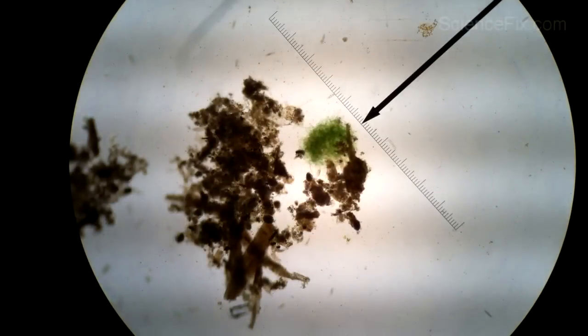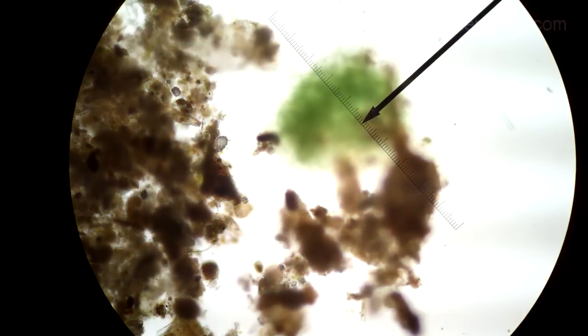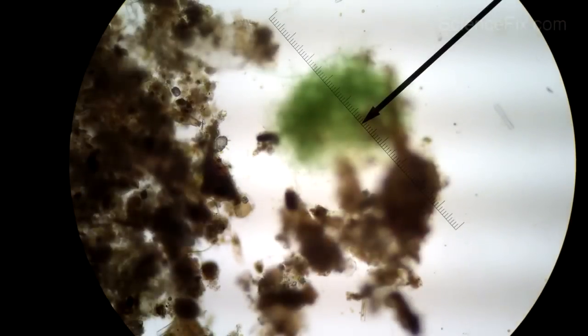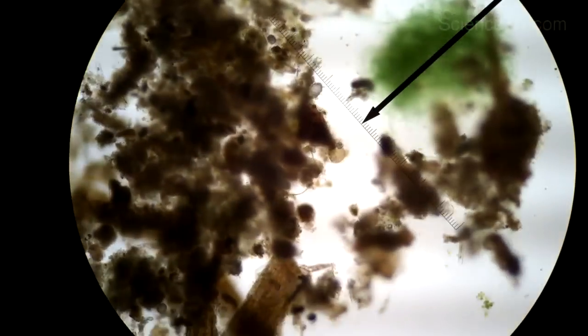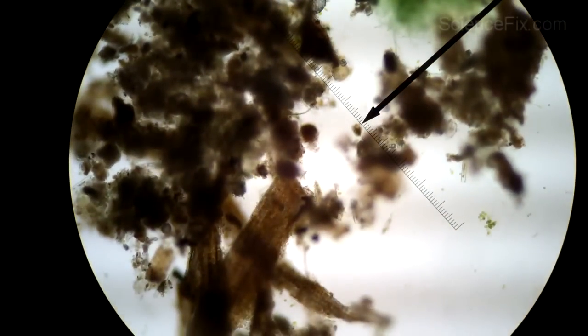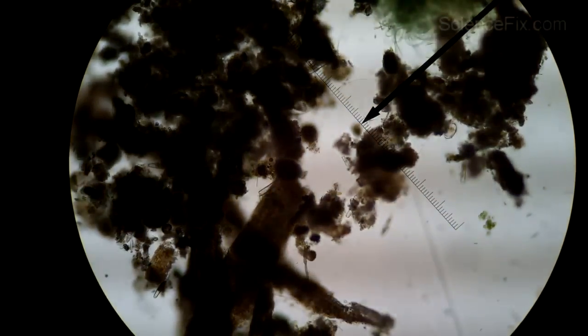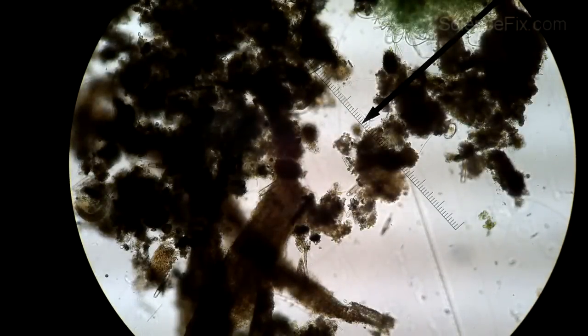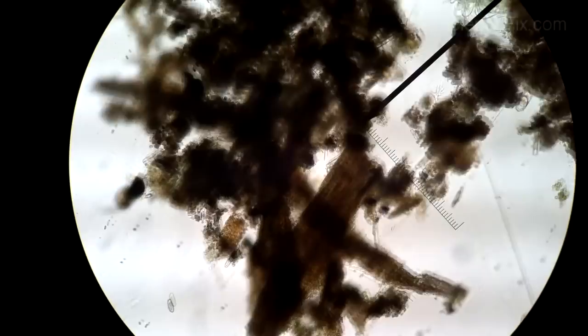Here we see a microorganism that's green. Anytime you see a green color, you think of an organism that can photosynthesize — using sunlight to take carbon dioxide and water and convert it into sugars, some glucose. Now we get a little bit more up close at higher magnification. It looks like there's some paramecium, which is pretty much a staple in a biology classroom. You can see how I adjust the diaphragm to reduce the amount of light going through it so you can see a little bit more contrast.